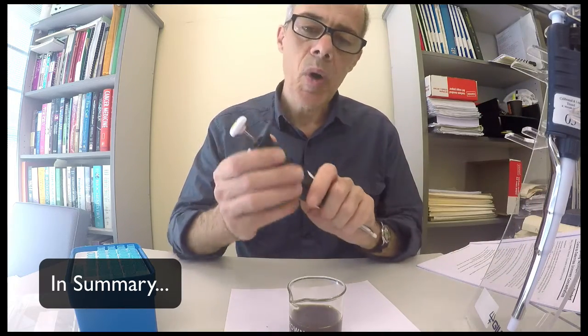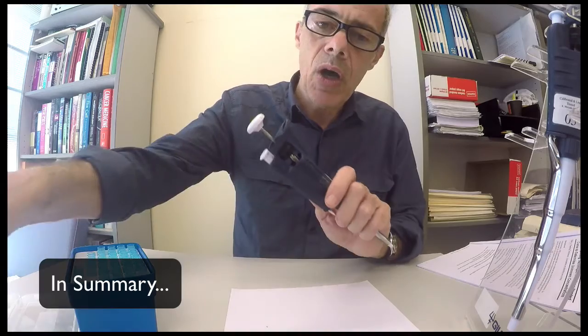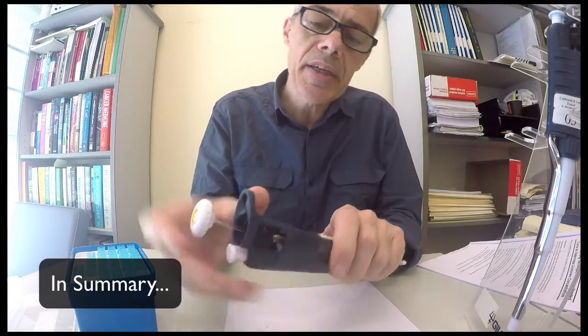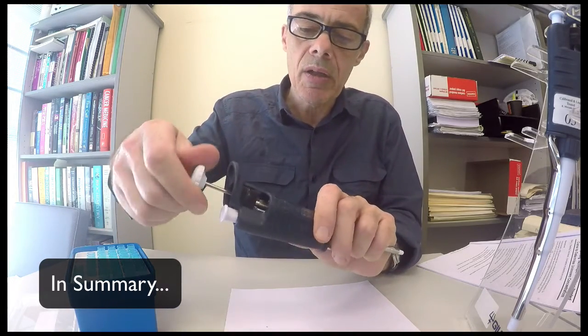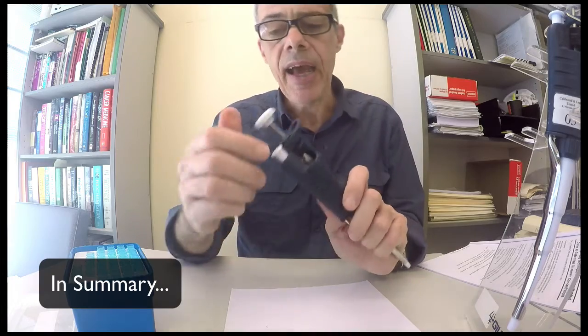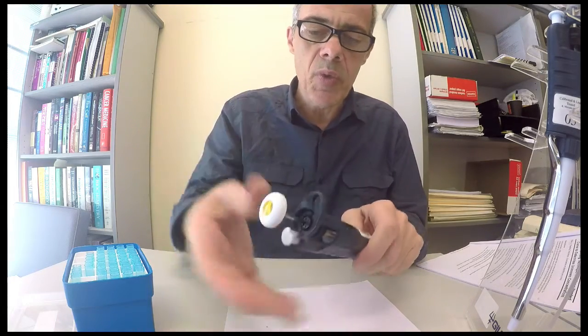Be careful when you're winding. It's very easy to overwind these things. Some people say, well, I don't understand what I'm doing, and I've got a P200 here, but this scale only goes up to 200. I want to wind it up to 500 because you're confused. You think it's 50 or whatever. And if you keep winding this thing here, which I'm not going to do, then this wheel here will start to exert a lot of pressure.